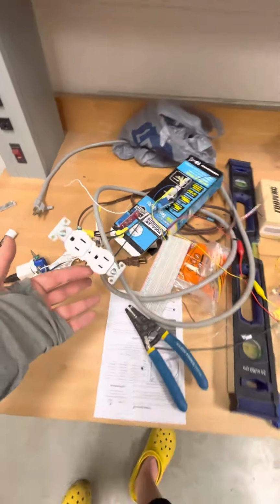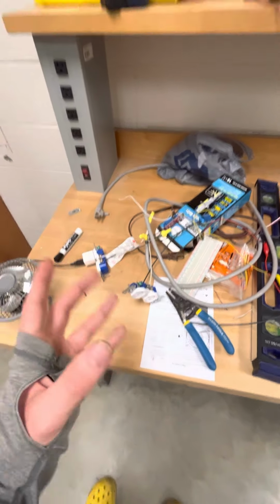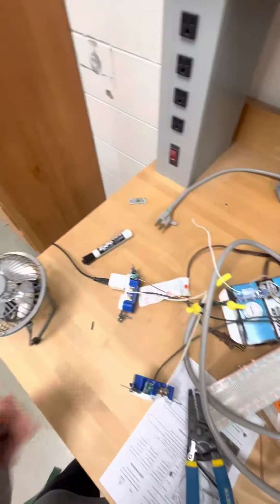And we're planning to integrate this entire thing into a single box, instead of just having multiple outlets. It's going to just be one single box with all the outlets, all the relays, everything all integrated into one piece. But the system is currently fully functional.